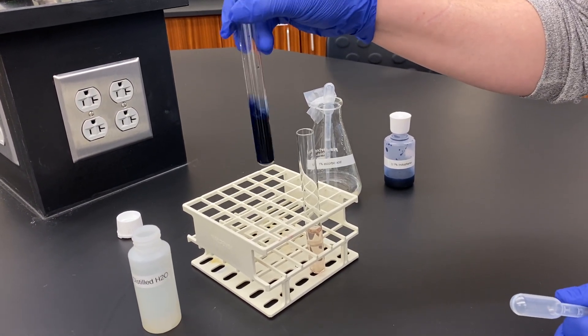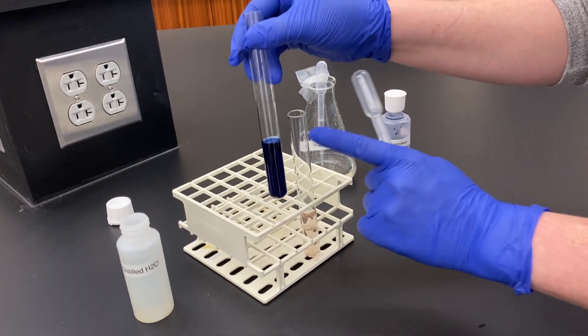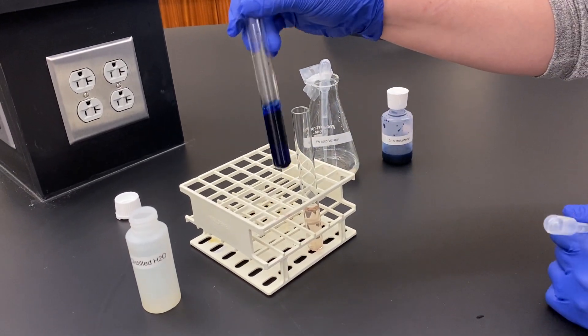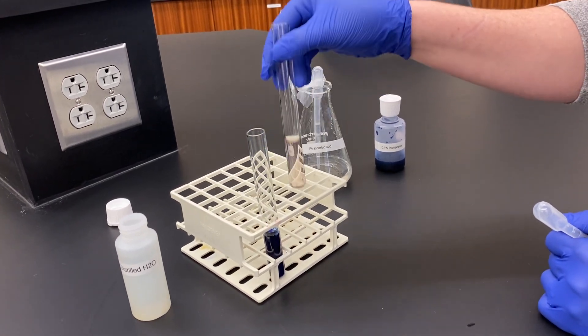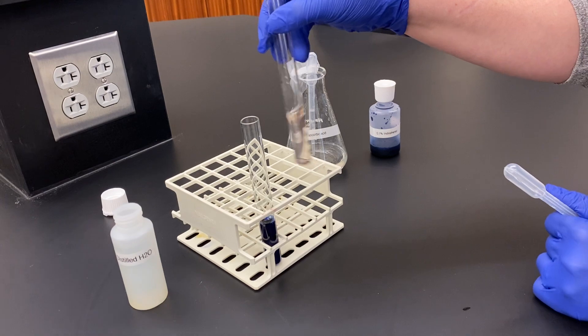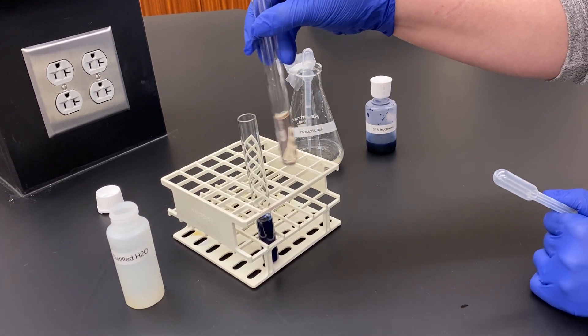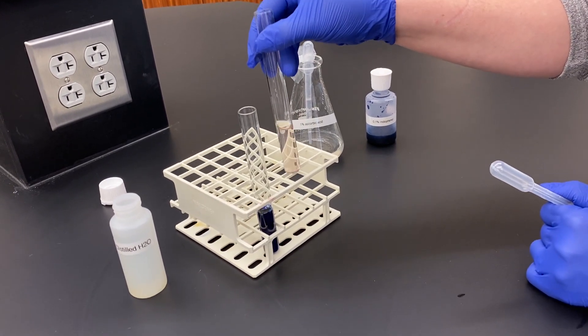Negative control, you'll have no loss of color—it's going to stay that deep dark blue. The more vitamin C you have, the more you're going to have that clearing, that decolorization occur.